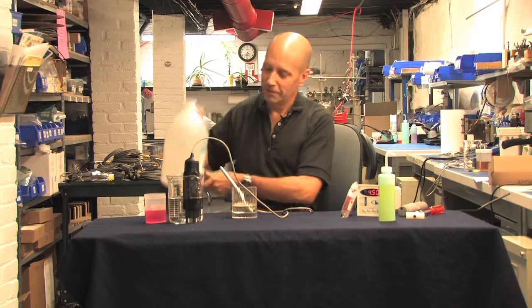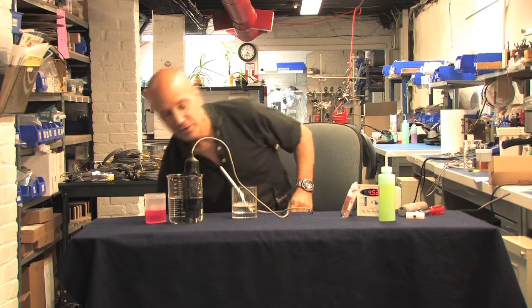That's about it. Follow these simple steps of maintenance, and for a few dollars a year, your Aquametrics probe will work like new for years to come.